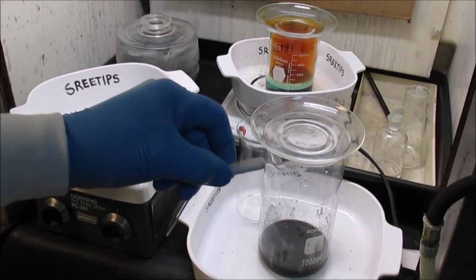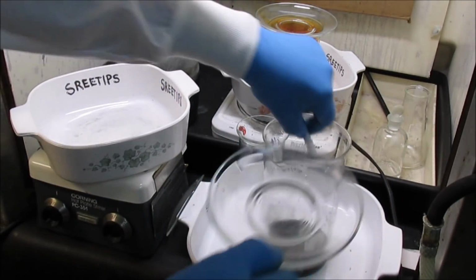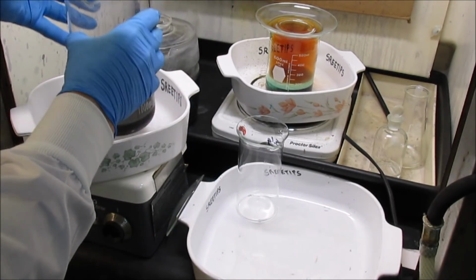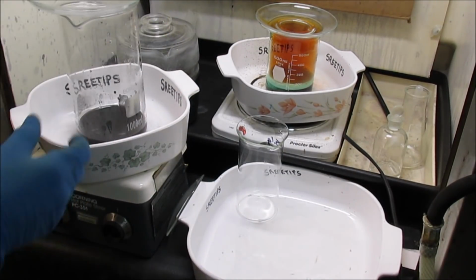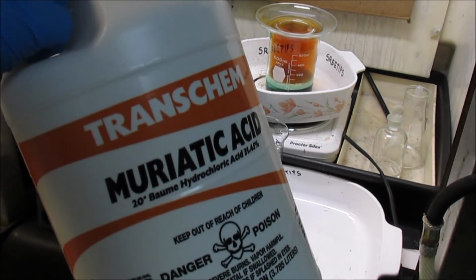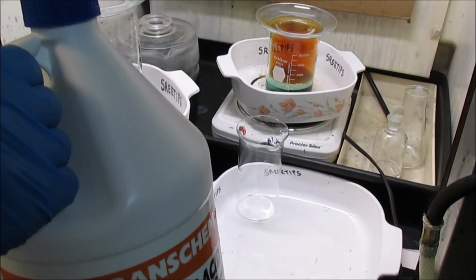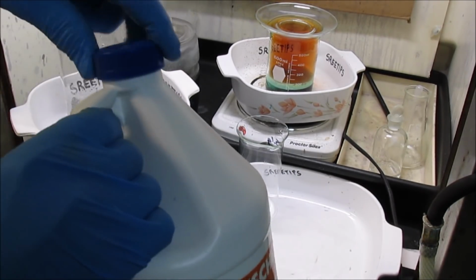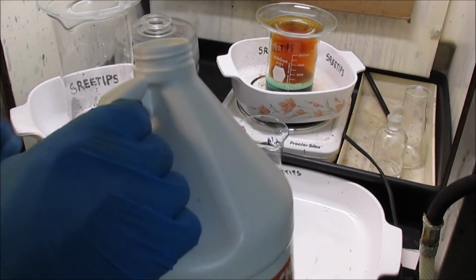I'm going to put the stir bar back in now. Set this back up on a stir plate and get stirring. Now I'm going to add hydrochloric acid and we're going to boil these black powders with hydrochloric acid, see if I can get some of the copper out of there.